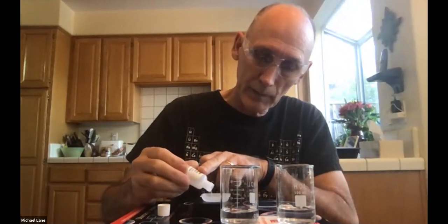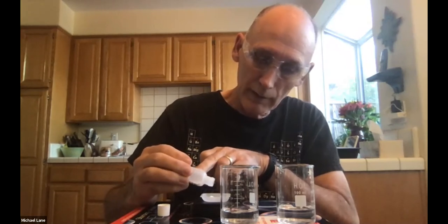Now, we said I needed 1.06 grams of sodium carbonate, and I am going to add this on here. You, of course, have the spatula. If you have the exact same container that I do, you can see I'm just kind of twirling it back and forth. Remember, it's always best to go slow so that you add a little bit at a time, because trying to put stuff back in the bottle is, of course, going to be difficult. So again, I know you can't see the scale. You just kind of take my word. There we go. Oops, a little bit too much. 1.09 grams, right? But that's more than the 1.06 grams that we know is the minimum.